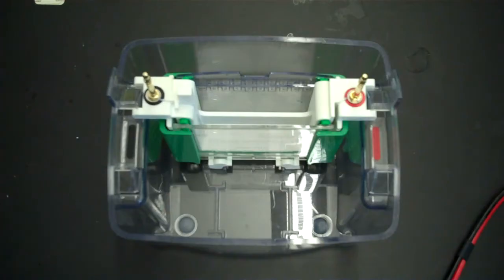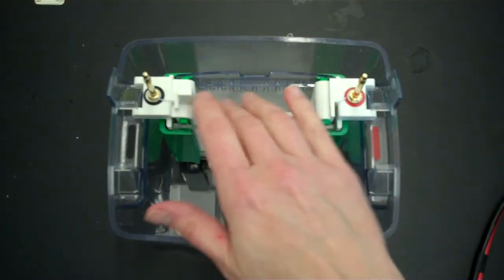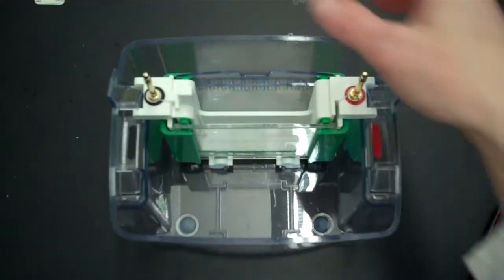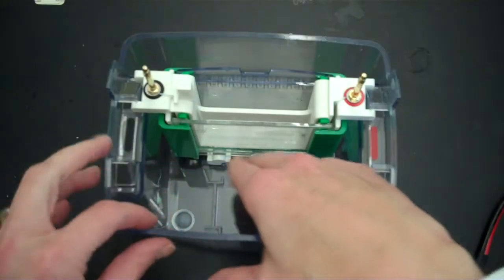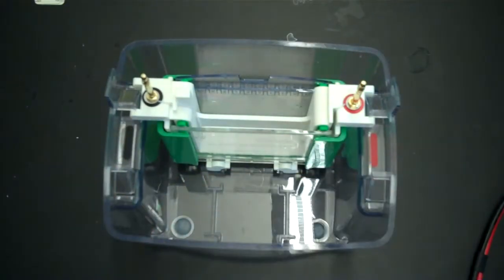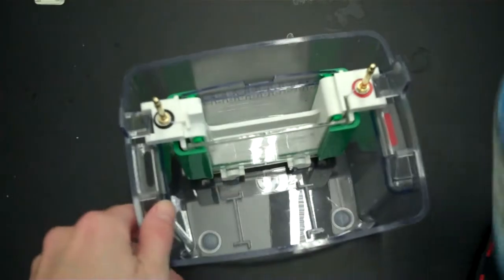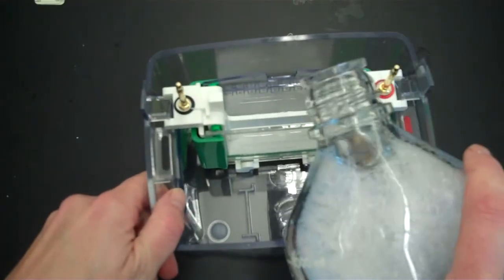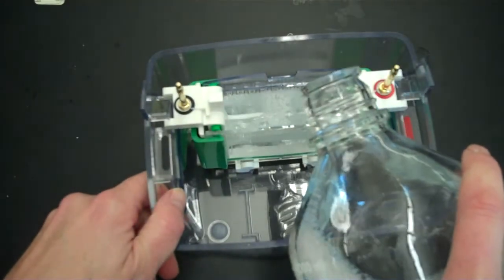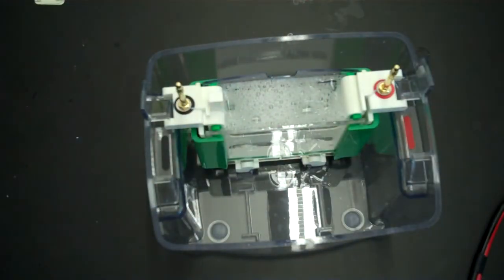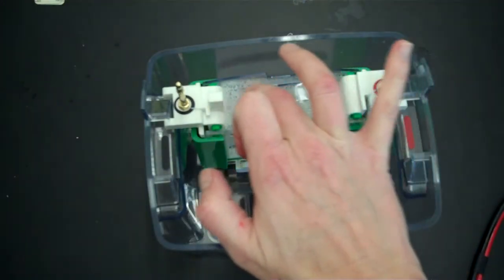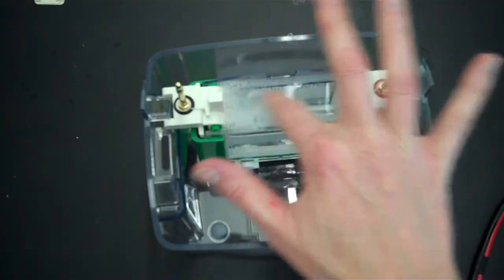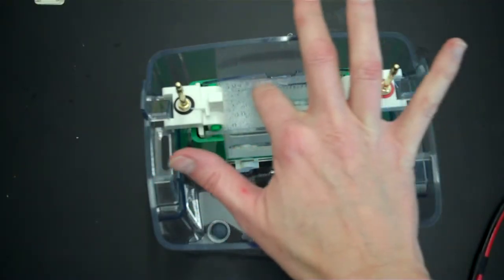Now there are two chambers. The inner chamber is what is going to be inside between the gel plate and the buffer dam. And then there's going to be also electrophoresis buffer that's going to go on the outside. The first thing you're going to do is fill that inner chamber. And you want it to go past that inner plate. So what I want you to see here is that there is this short plate right here and the buffer has gone past it.